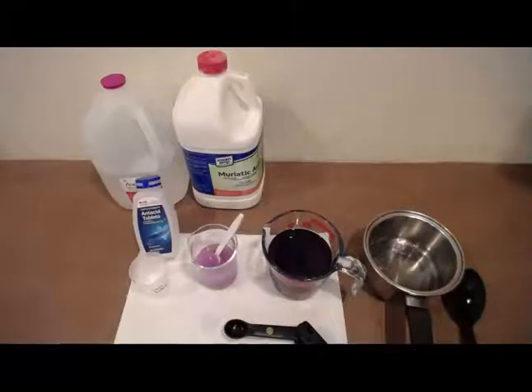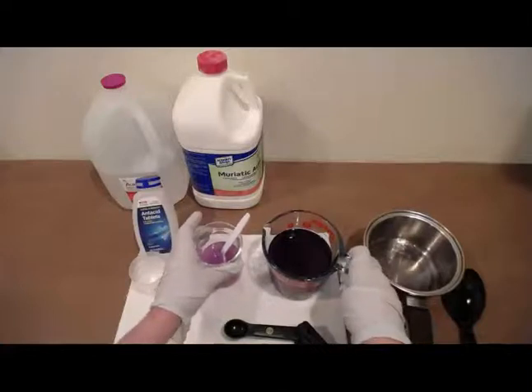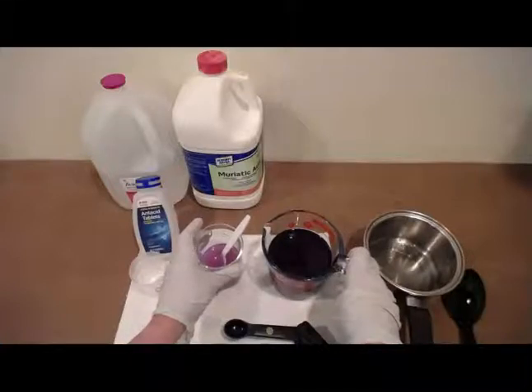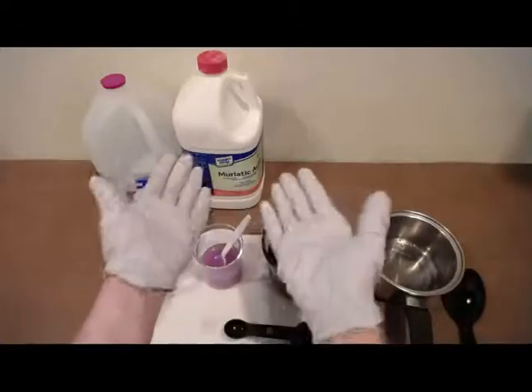Okay, make sure you have recorded all of your observations in your results section, and don't forget to write up your discussion and conclusion and reference on your laboratory journal. Because you've been handling acids, take care to clean up, pouring it down the sink. Make sure you have your gloves on and your eye protection even while you're cleaning up. And then carefully remove your gloves so that you don't get any splashed acid on your skin as you're removing them.